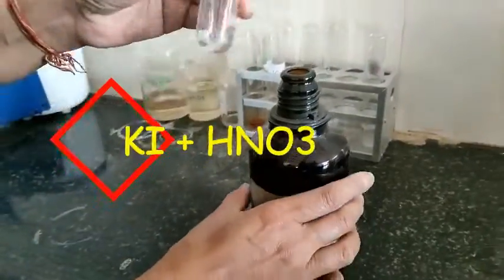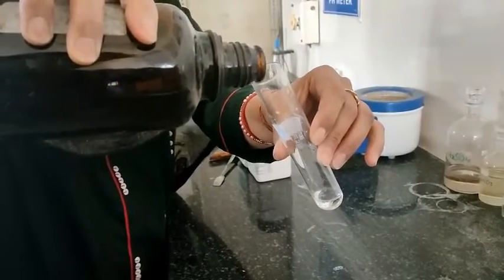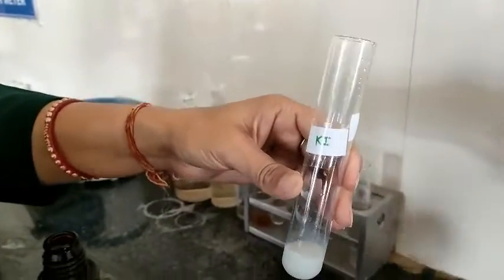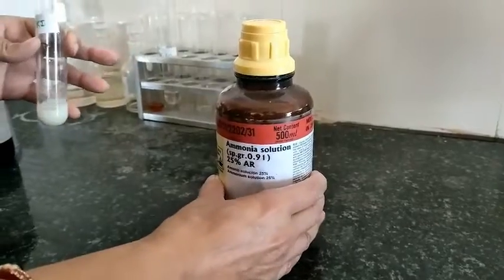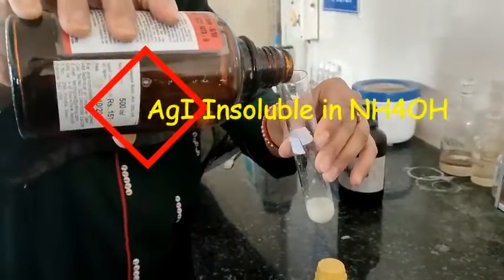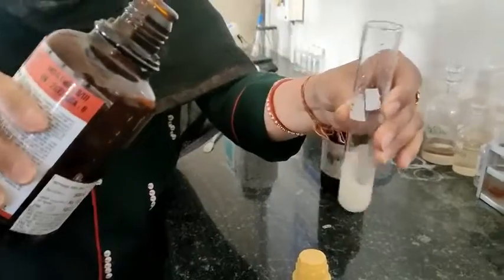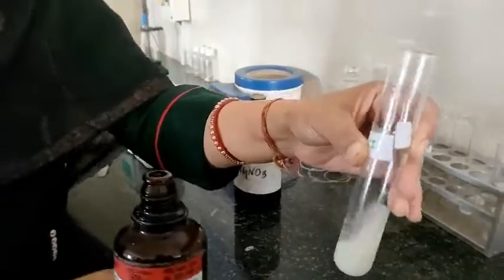Test for iodide ions. I have taken the sodium extract and to this I have added silver nitrate solution. You can see the pale yellow color — it should be light yellow. These silver iodide precipitates are insoluble in ammonia solution. Here I am adding ammonia solution, and you can see these are insoluble.